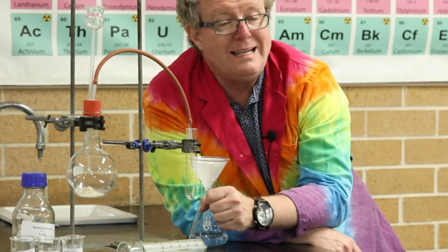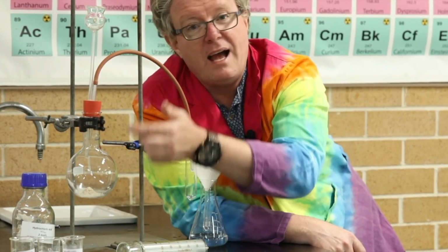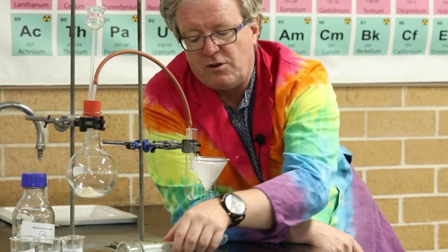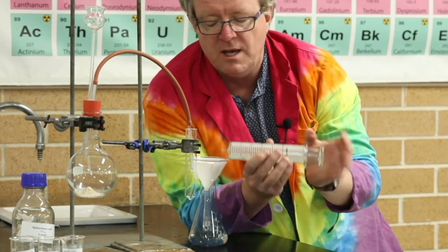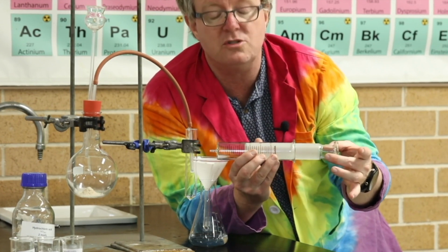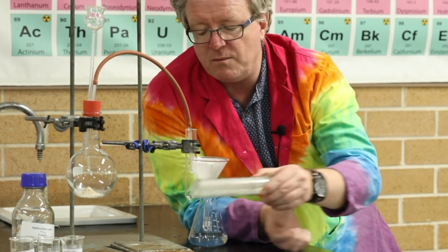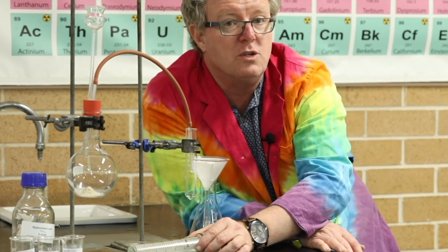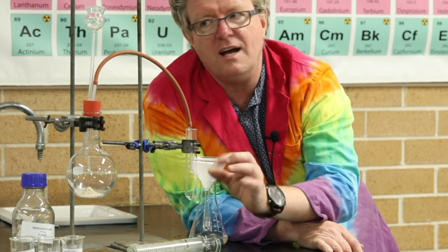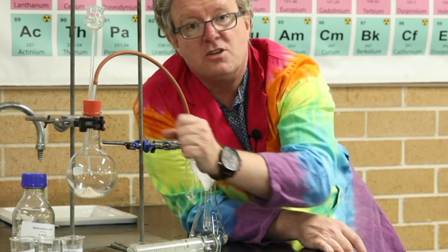Because we've previously talked about limiting reactants, and we can work out which ones are limiting, and we can then calculate how much volume of CO2 would be produced. So we can actually measure that volume, and we can use something called a gas syringe here. And so we can attach this to the end, and that will collect the gas produced, and we can measure precisely the amount of volume. And by doing that, we can calculate the number of moles of CO2 gas. And of course, we could even calculate the number of molecules. So being more precise means that we have to use a thistle funnel because we don't want to lose any gas. And so let's do that experiment.